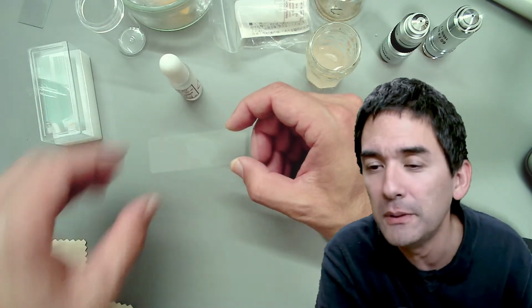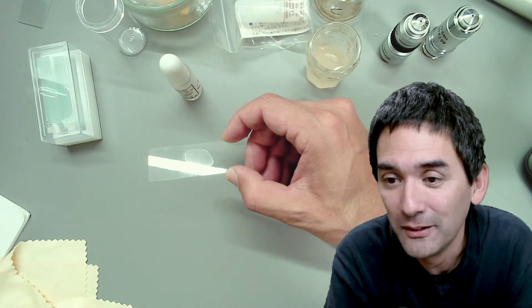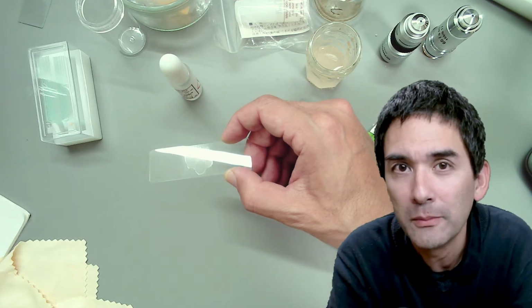Okay, so there have been a few more comments. Thank you for your videos from Nova Scotia, Canada. Thank you. I'd recommend cleaning off all oil with an appropriate solvent if you're going to store the lens for long term. Yes.